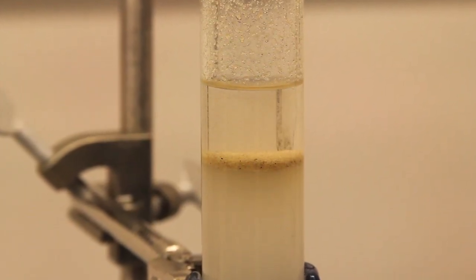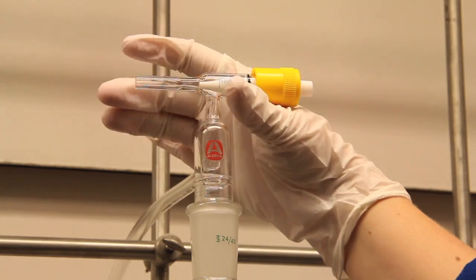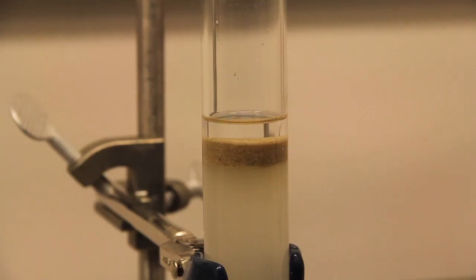At this point, I like to add a layer of sand for protecting the surface of the silica. Now I can bring the solvent to the level of the sand and then we are ready to load the column.